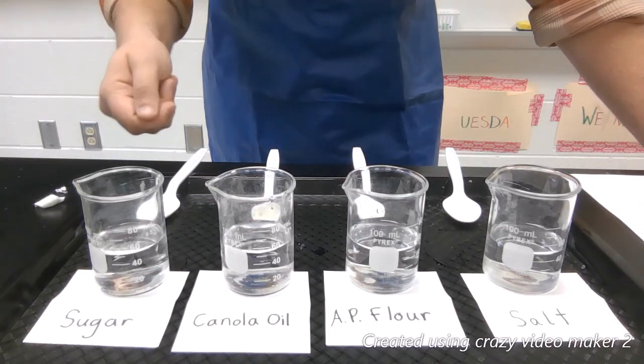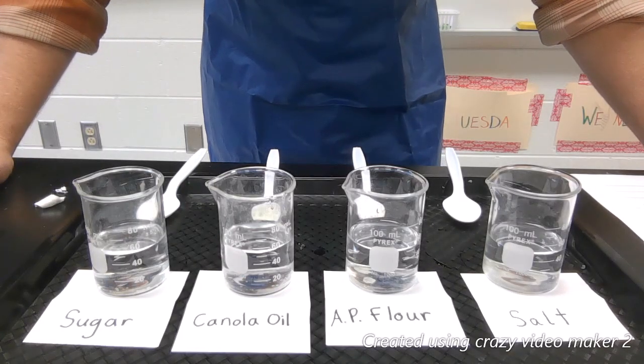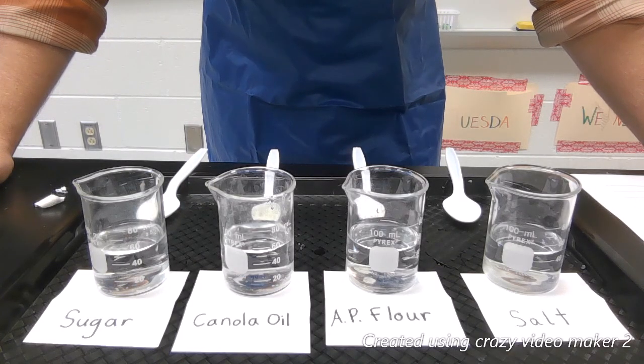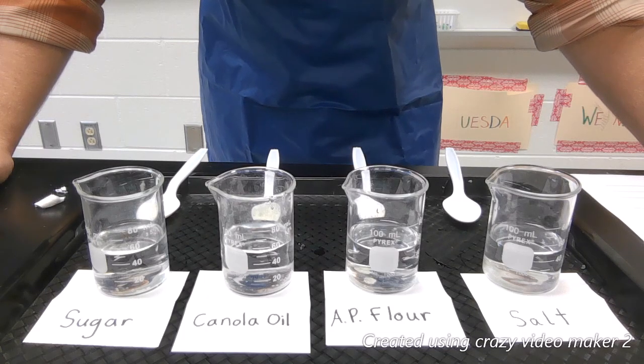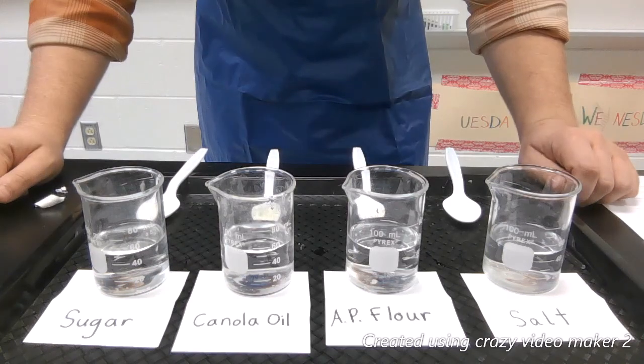I'm going to put one of these items into each beaker and we'll see whether or not water is able to create a solvent or combine with these materials.